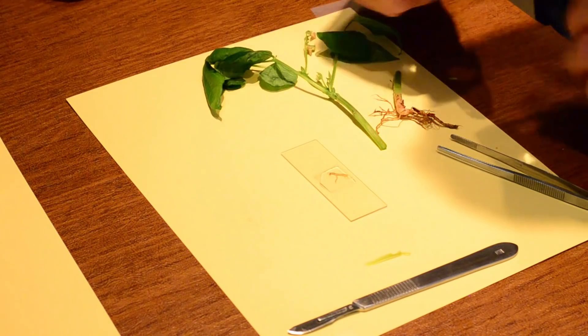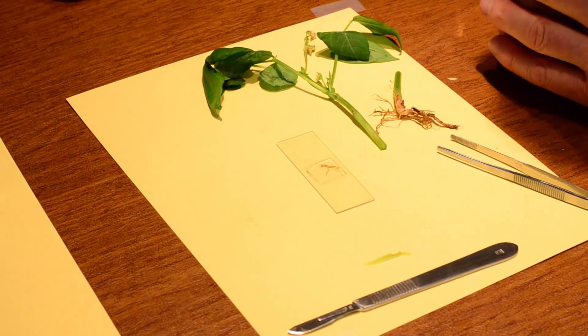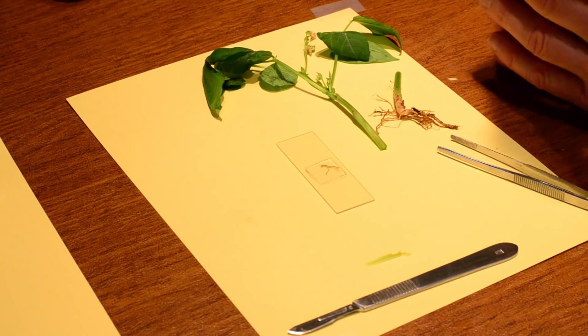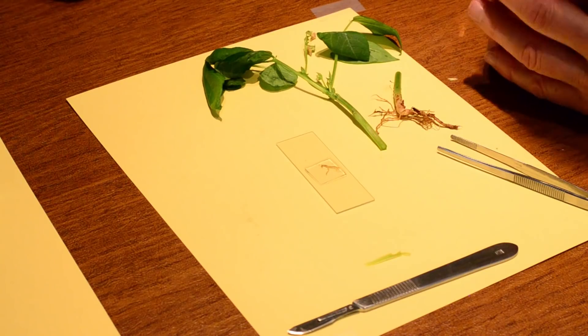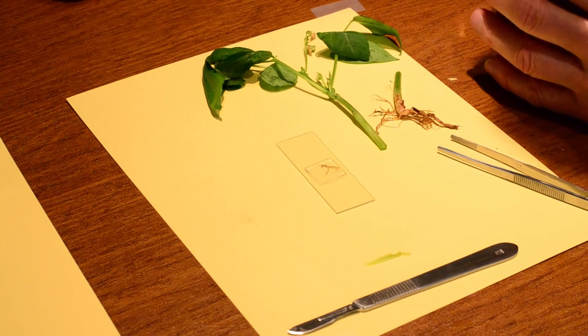And if there's not a lot of water all the way through, it looks like it's coming. It looks good. So now I have my root. I'll be able to see root hairs, vascular cylinder, and various tissues that are participating in absorbing water and nutrients.